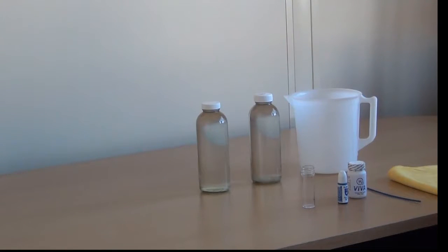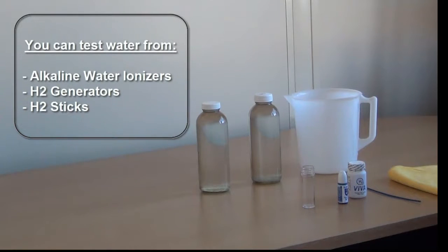Drops can be used to test for hydrogen in water from other devices such as alkaline water ionizers, H2 generators, or H2 sticks.